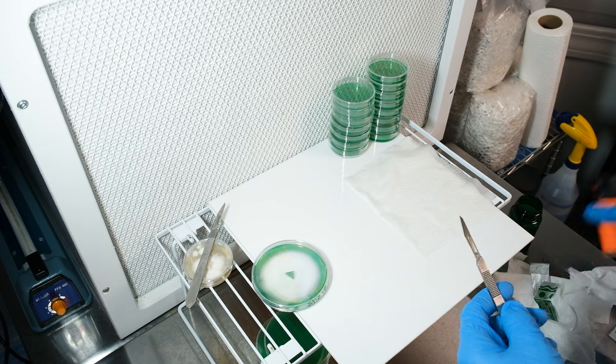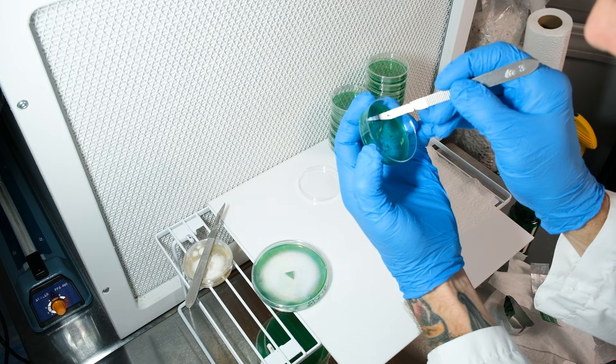What we're trying to do is create a physical barrier that the mycelium can traverse but the bacteria cannot. The first method is called sequestering or trenching. Just like the name implies, we put a sample of the contaminated culture on a little island — we take a hot scalpel and carve a trench on our agar plate, drop a sample in there and sequester it. With your work surface prepped and sterile and your plate ready, flame-sterilize your scalpel and carve a U-shaped trench on one end of the plate.